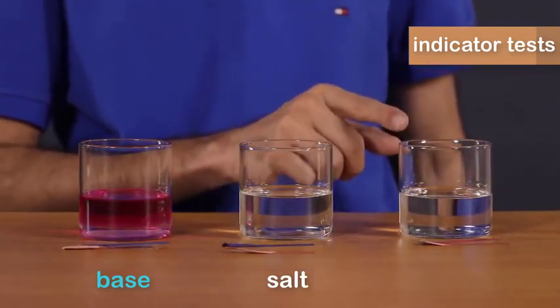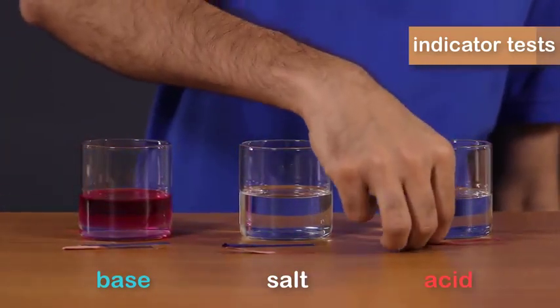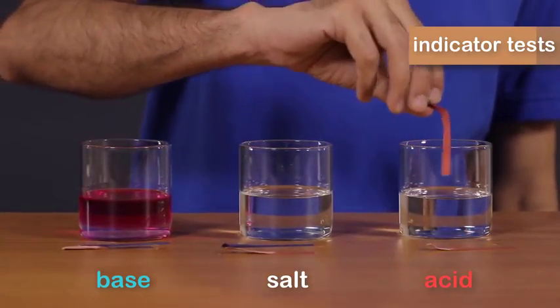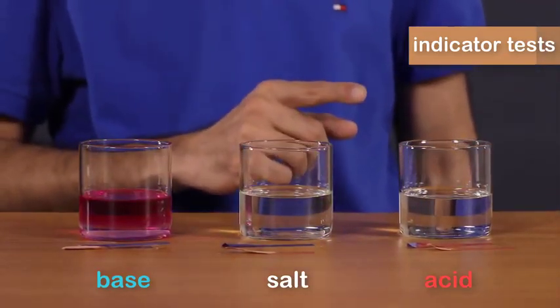And the third solution is an acid, because here you can see the red litmus paper remained red, but the blue litmus paper turned into red color, and phenolphthalein gave no color change.